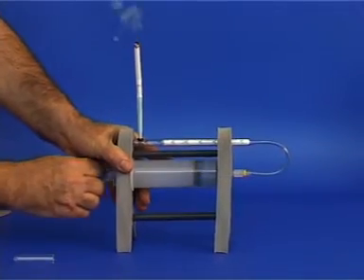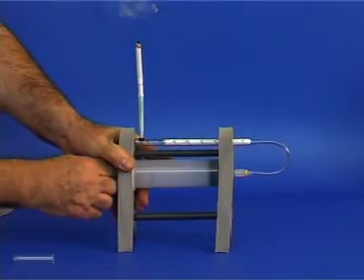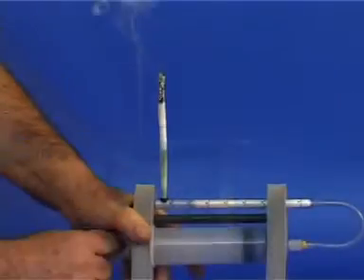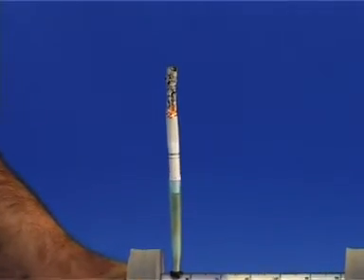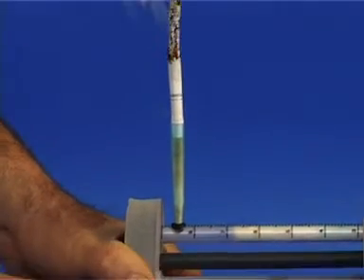Pump the vacuum simulating the inhalation action of smoking. Note the accumulation of a yellowish brown colored material accumulating on the cotton filter.